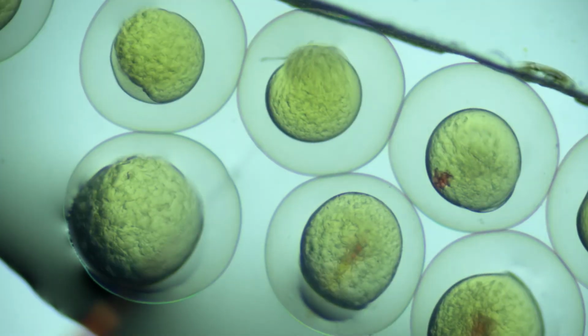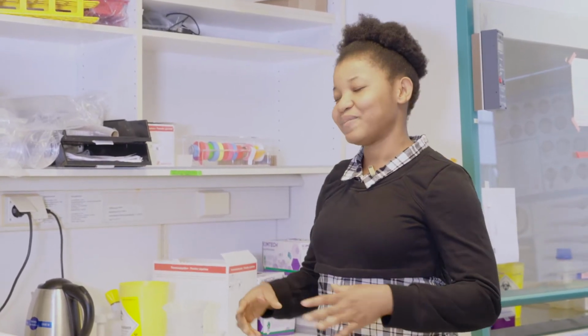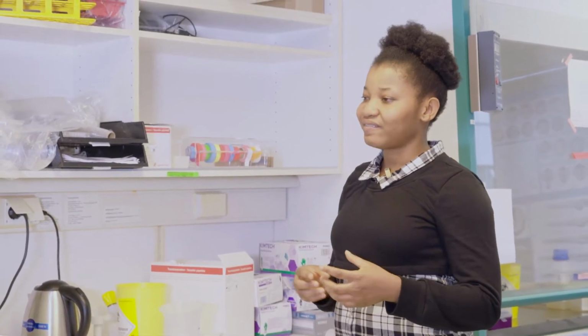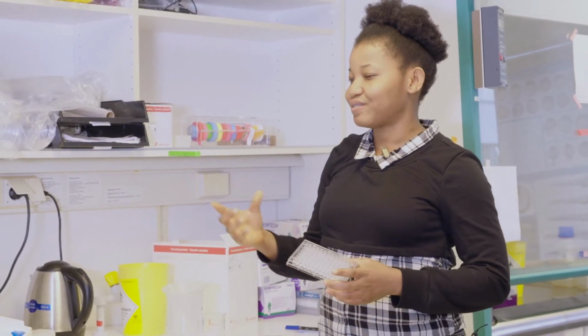What do you think are the strongest advantages of working with zebrafish? First, my favorite: the fact that it's easy to handle. I have worked with mice and rats before, and I can tell you it's a lot more difficult, even picking them. With zebrafish it's a lot easier, and the space they use is very small, so in terms of running cost, it's cheaper. Secondly, they are small and able to fit into 96-well plates. At 5 days old, they are about 4 millimeters long.